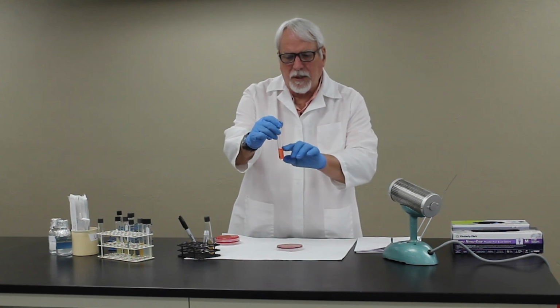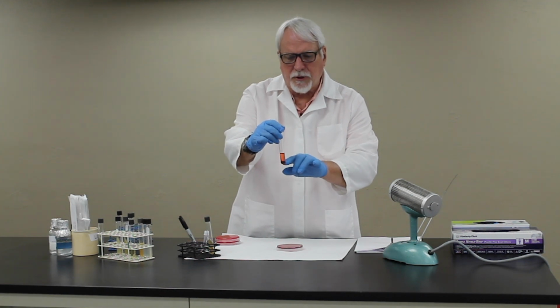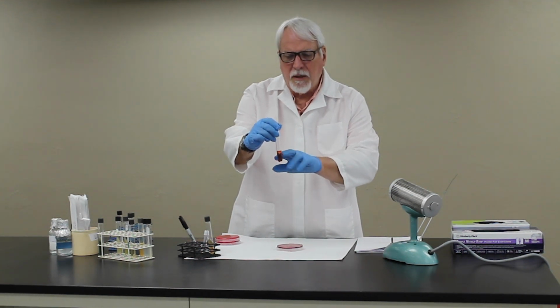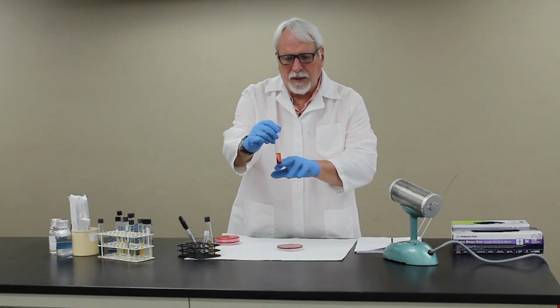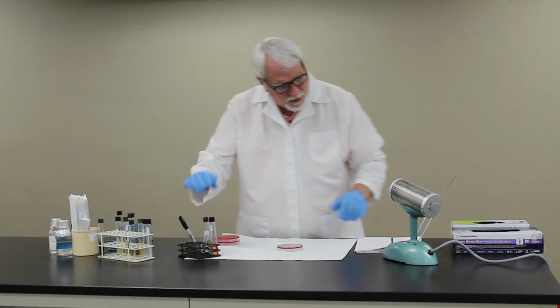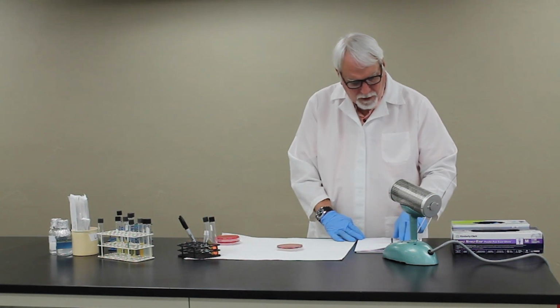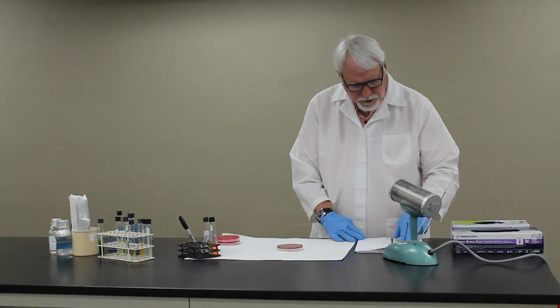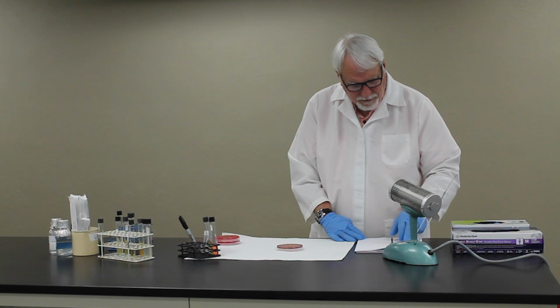If the organism produces acid from that particular sugar, it's going to turn the phenol red indicator yellow, which will indicate acid production from that sugar. So that's also going to help you differentiate many of these organisms that are streps. And again, the streps will be Catalase negative, the staphs Catalase positive.